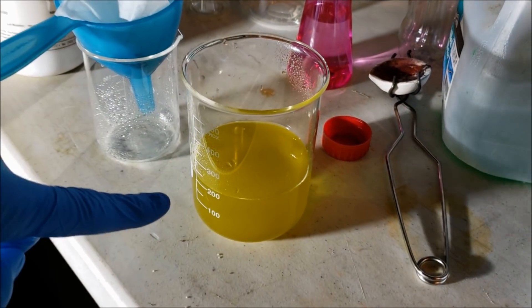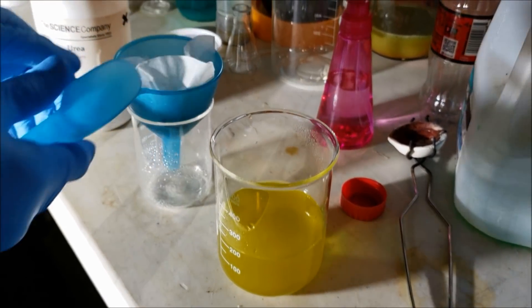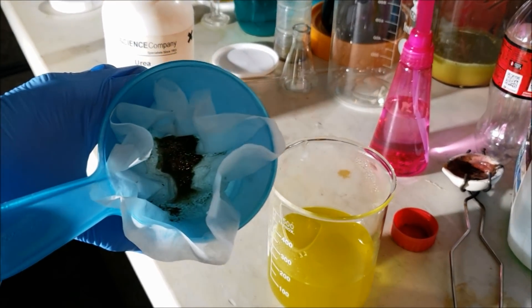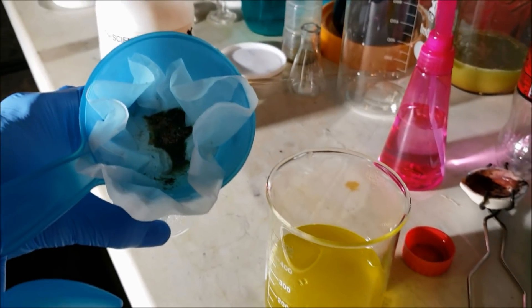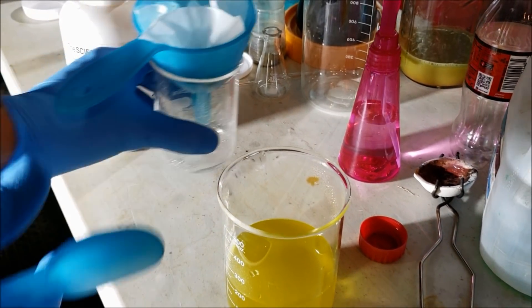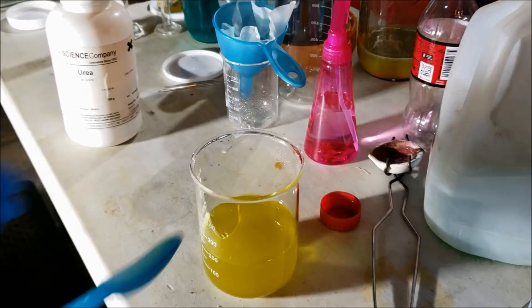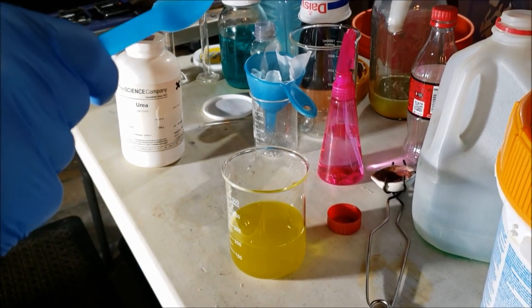There you go — that's my melted gold in solution. That's all that's left at the bottom — those are just little scraps of fingers and crap that you don't want. Right now that's still hot acid, so we have to neutralize it.